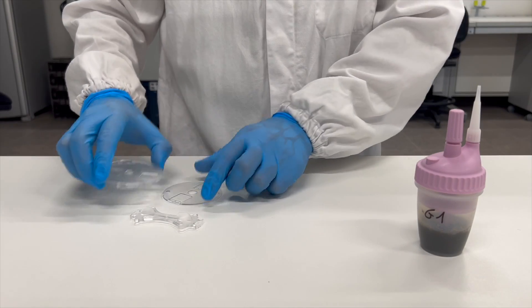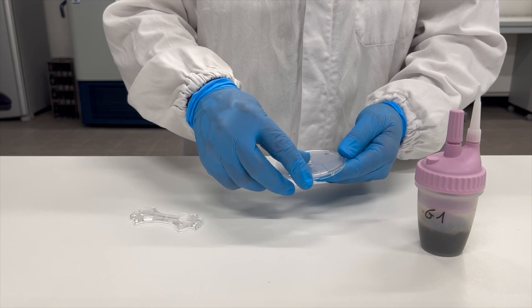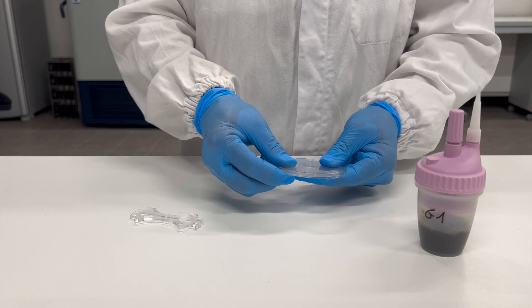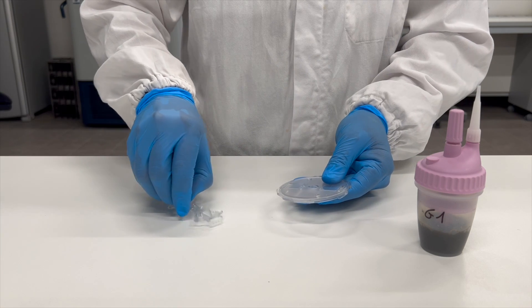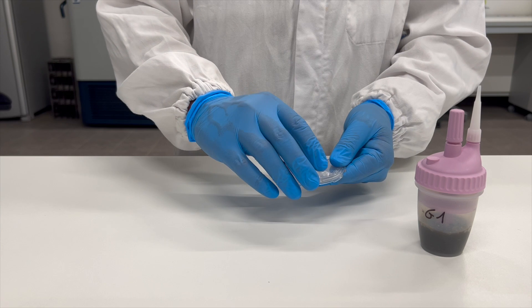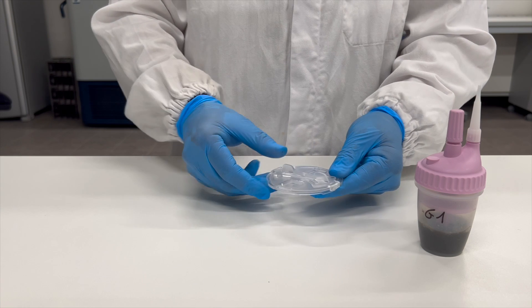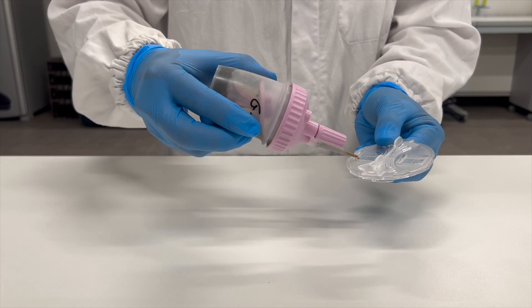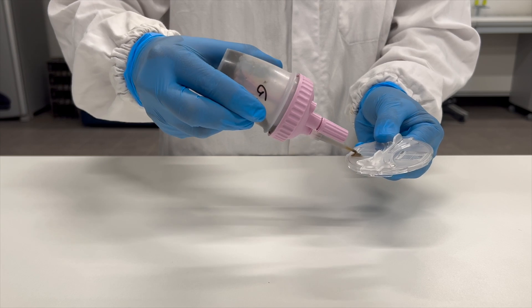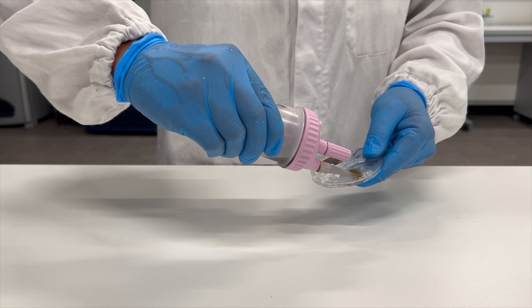Assemble the MINI FLOTAC and rotate it until it reaches the filling position. Fill the two chambers with the faecal suspension. Allow the FLOTAC device to sit for 10 minutes for the faecal flotation of the parasitic elements to occur.